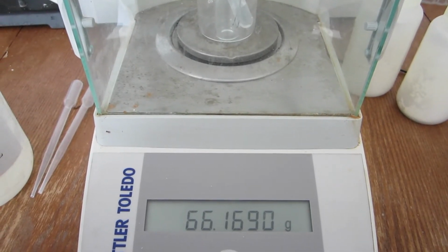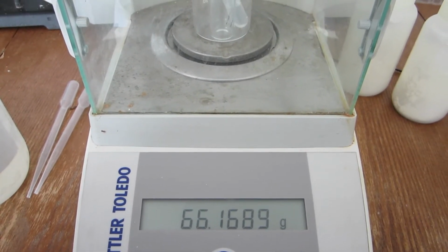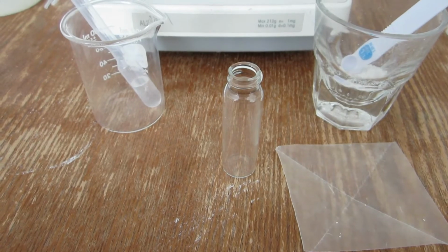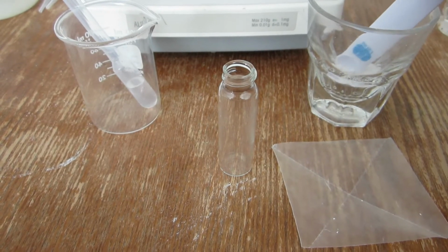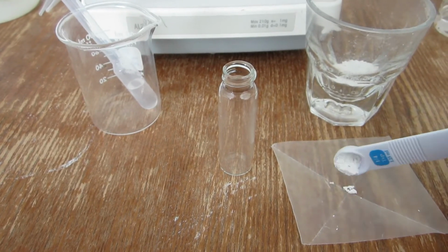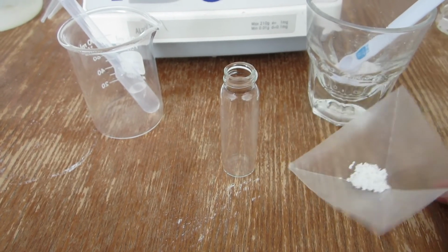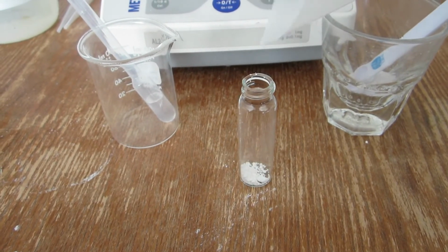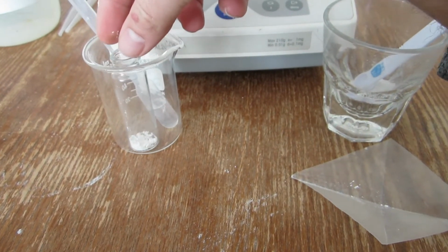For the first trial, the mass of the empty vial, beaker, and pipette filled with acid are displayed. As with the baking soda and baking powder samples, a small amount of carbonate sample is added to the vial. This particular sample does not flow as well from the measuring spoon, and a piece of weighing paper will be used to deliver the sample to the vial. After which, the combined mass can be determined.